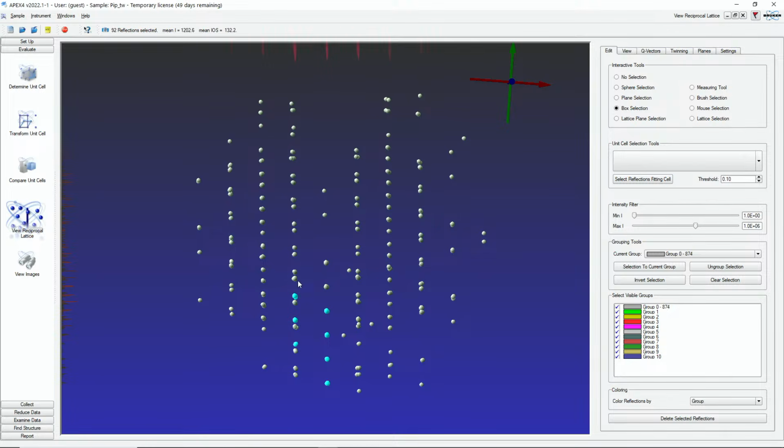This method is maybe more useful when you really know how twinning works, but then it's really powerful. So here I select them on top, and you see we get these lines. I select these on the bottom, and then you see how it moves in this direction. So we need to select only a few of these reflections, and then that will be enough to index. You just have to give it enough to get started, and then it can go from there.